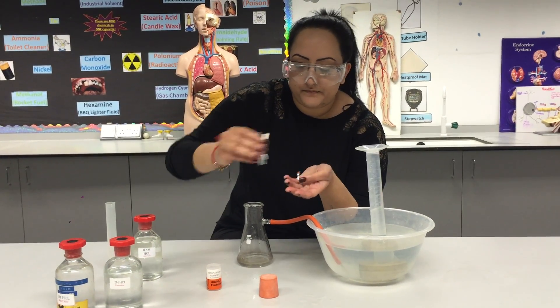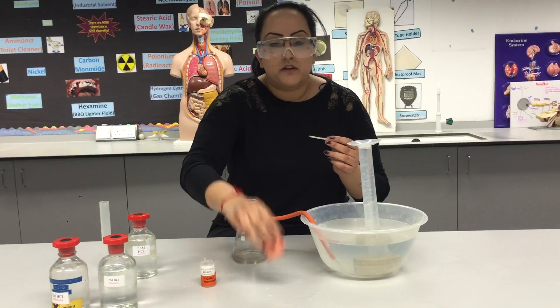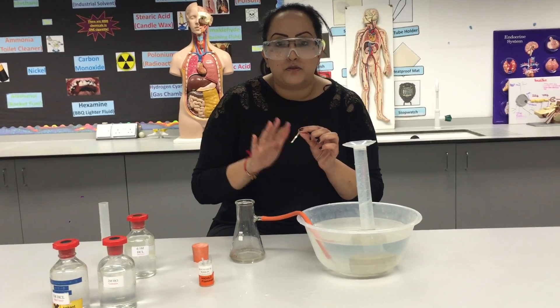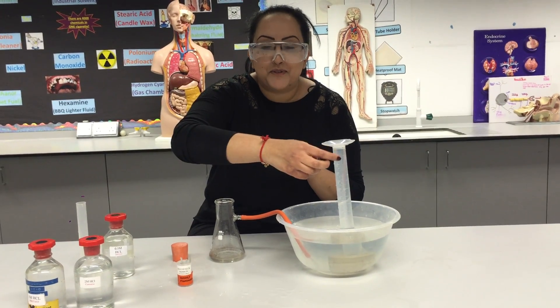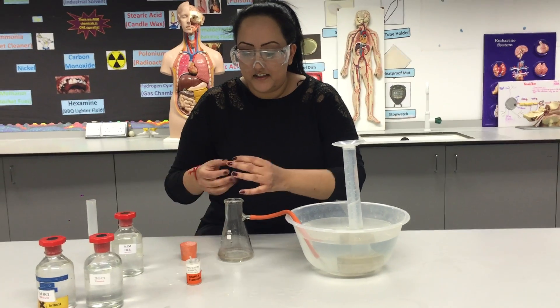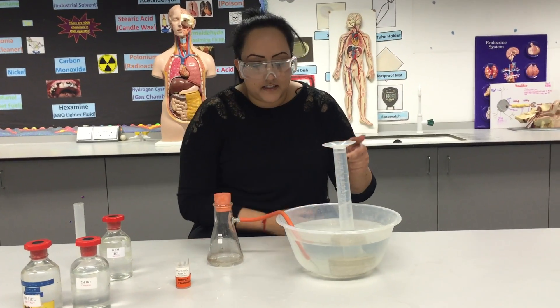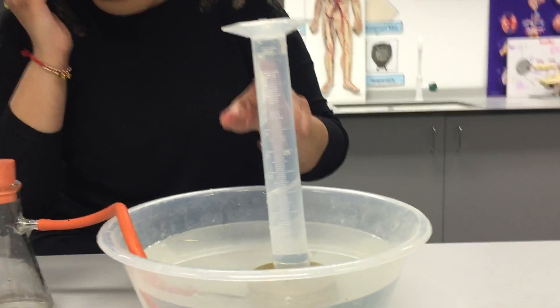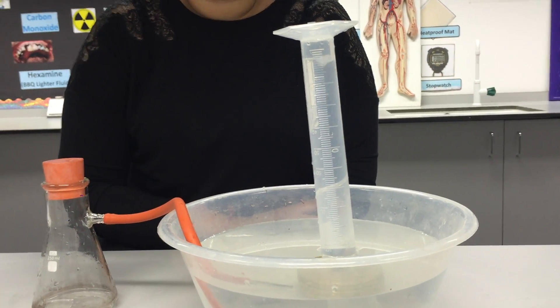Get your piece of magnesium in one hand and get your bung ready, while your partner holds a stopwatch. As soon as you put the metal into the acid the reaction will take place straight away, and you are going to measure how long it takes to produce 50 cm³ of hydrogen gas. Put the magnesium in and start the timer. As you can see, the reaction is starting to happen between the magnesium and the hydrochloric acid and you are slowly but surely starting to produce hydrogen gas. Measure how long it takes with your stopwatch to make 50 cm³ of hydrogen gas.